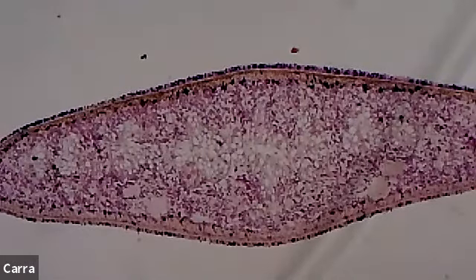But what you can see is, of course, the ectoderm, that outer part, the mesoderm, which is really just all the pink that you're seeing, the musculature. And then all of those different cavities or spots where it's lighter, a little bit lighter pink or even white, those are cavities literally of the digestive cavity, okay?